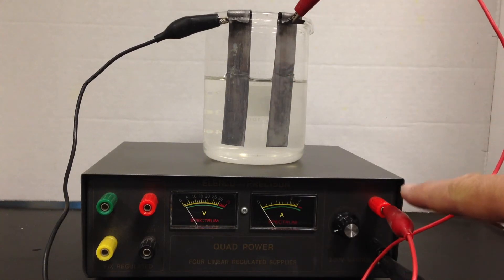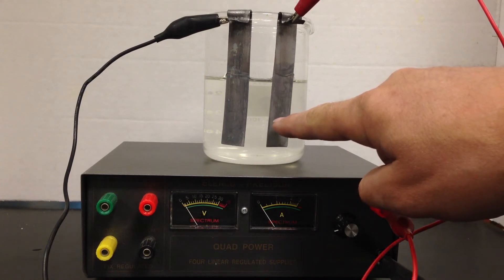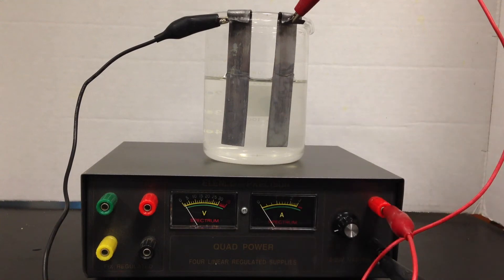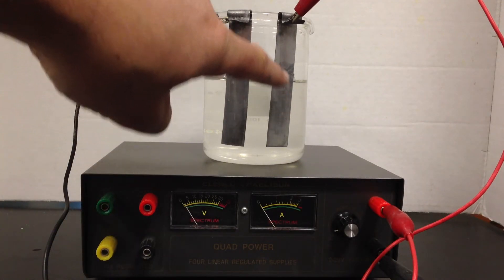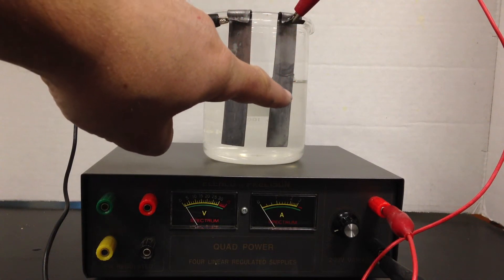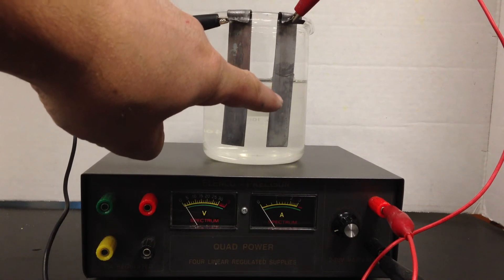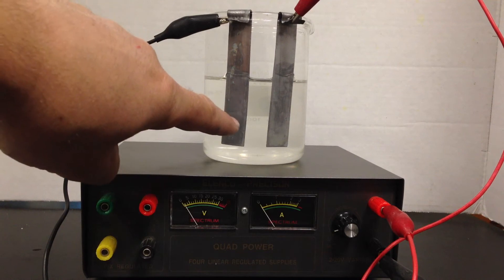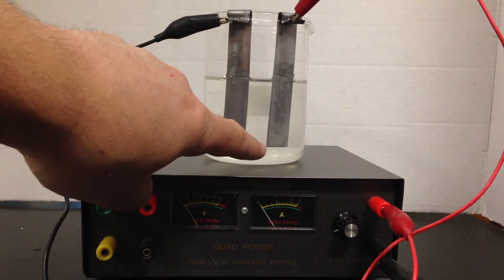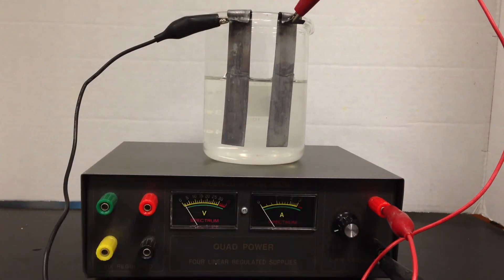On the other electrode — the anode — electrons are sent back to the cathode of the battery. This causes the solid metal to become ions, so the anode gets smaller. Oxidation is forced here: lead⁰ becomes lead²⁺. At the cathode, reduction occurs: lead²⁺ becomes lead⁰. So the cathode should get bigger.